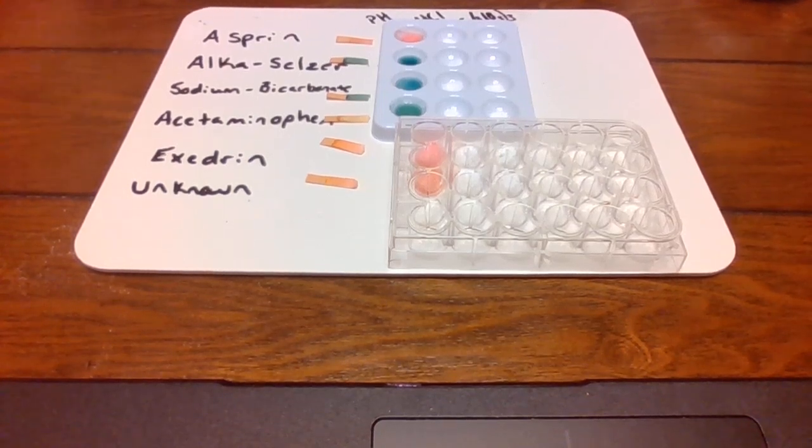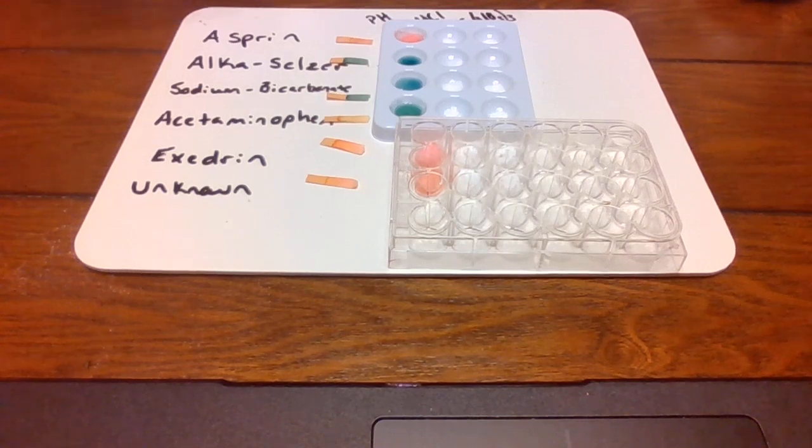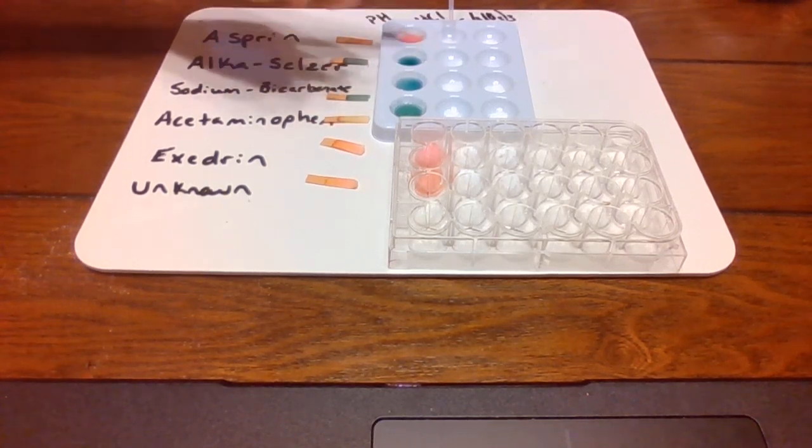All right, so now Max is going to put in our next one. Our next test for you to write down in your lab is to put in HCl, hydrochloric acid, which mimics stomach acid. All right, Max, you're gonna come up here and put in our drops of hydrochloric acid so you can tell them what happens. It's hydrochloric acid, and it mimics stomach acid, and you're gonna put it in the middle. So right here, just put 1 to 2 drops.